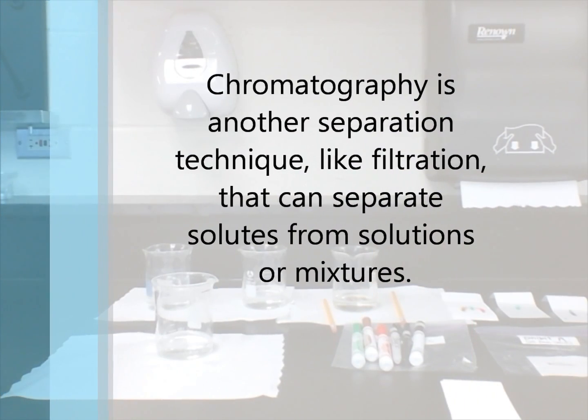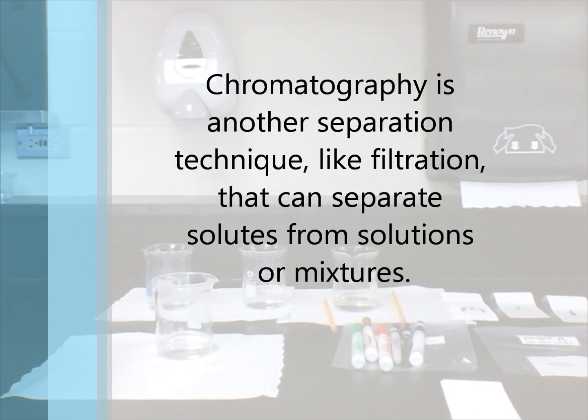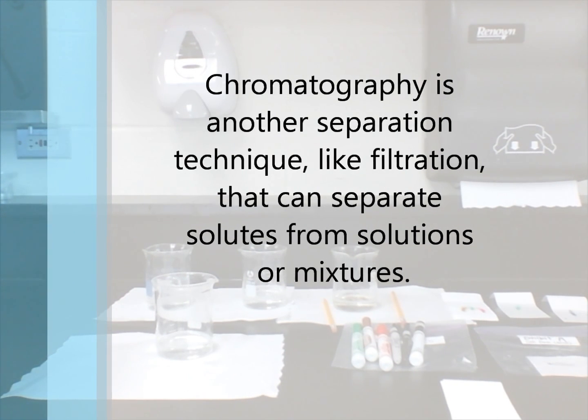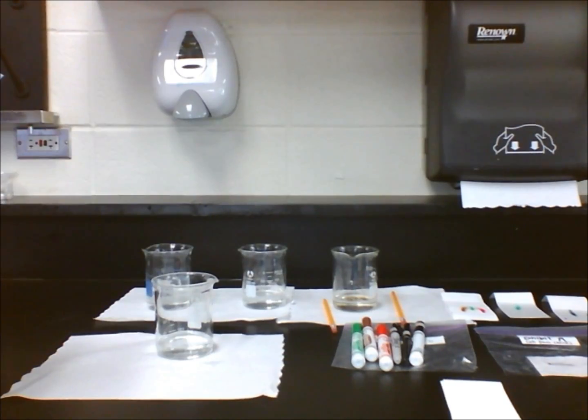In lab 17, students learn that chromatography is another separation technique like filtration that can separate solutes from solutions or mixtures.